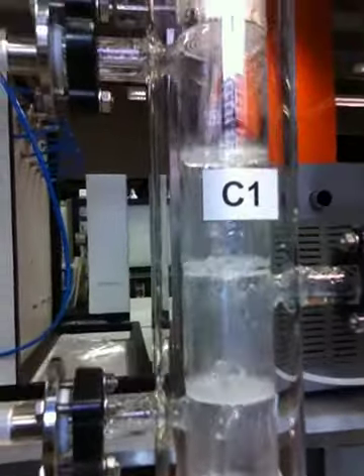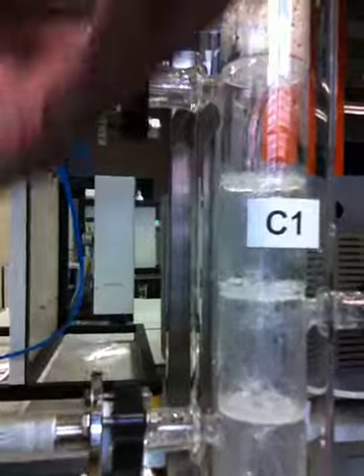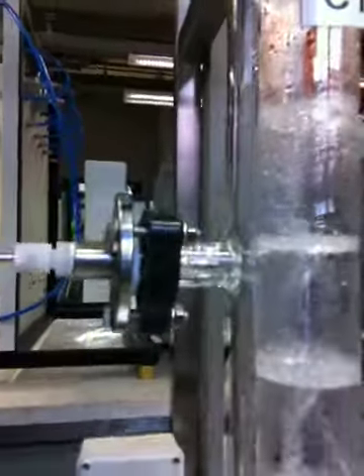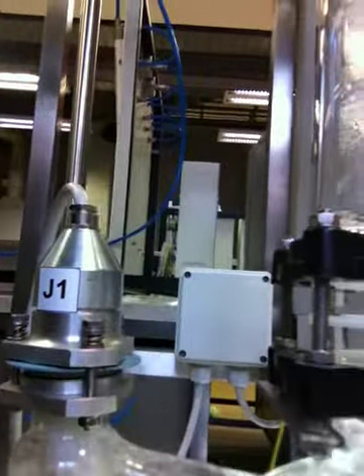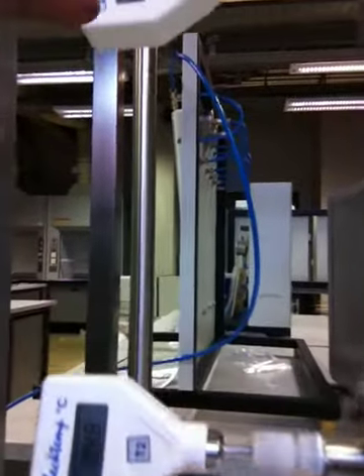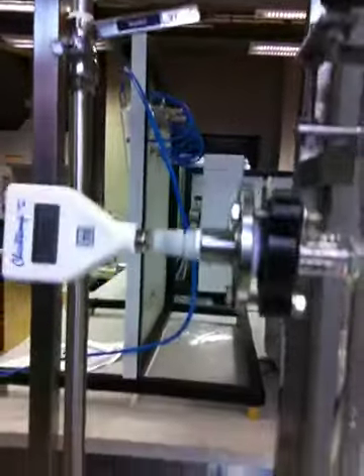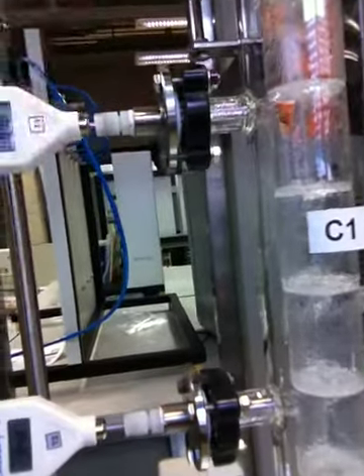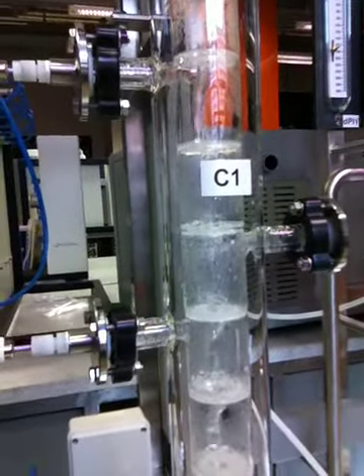It's a 7-stage column. So it means your vapor will be going through each and every stage until it reaches the condenser. Now before we reach there, we have different types of valves. Like this one, we have the temperature control, which is T1. We have T2 here, we have T3, and we have T4. The use of these temperature controls is to control the total temperature of the process as it reaches a certain maximum rate.